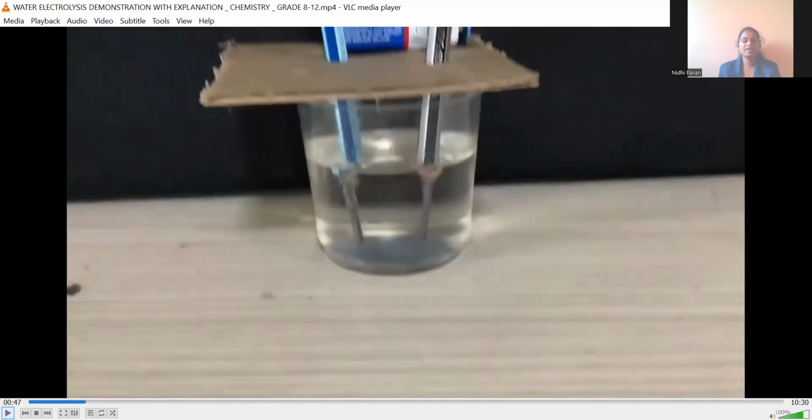Now, as you can see, the red wire is connected to the positive terminal of the battery, that is, the blue color pencil is the anode, positive terminal, and the Apsara pencil, what you can see, is connected to the negative terminal of the battery. So consider it as the cathode. Now, both the wires are connected to both the terminals of the cell, and as the experiment proceeds, you can see certain bubbles at these ends. Both the pencils will be getting the bubbles. Please concentrate on the pencil where the bubbles are rising upwards very fast.